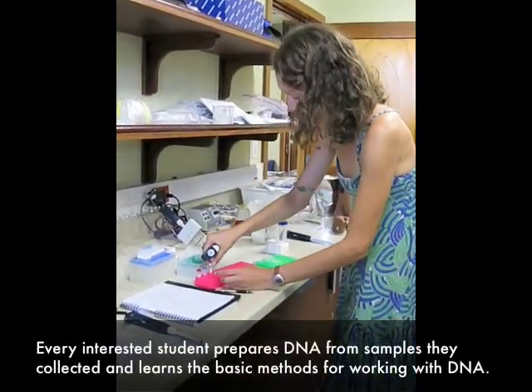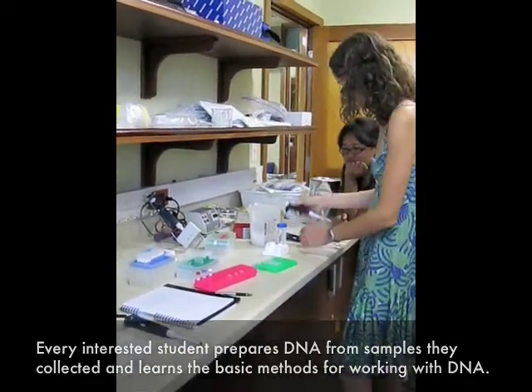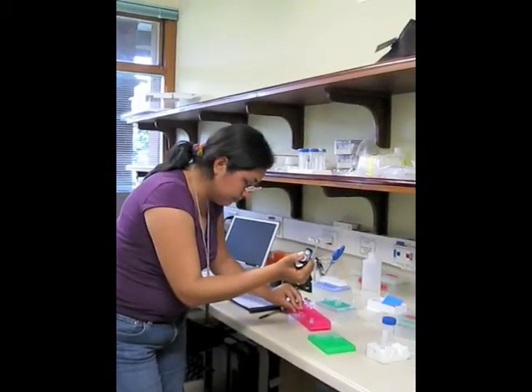Find, find the other. Alright. Not the other one. Alright. You want to set that at 18 now? Yeah. Oh, the weight is down there.